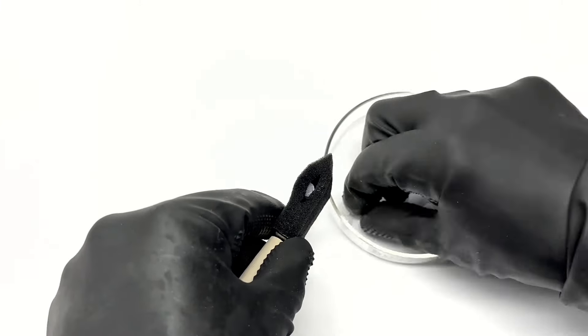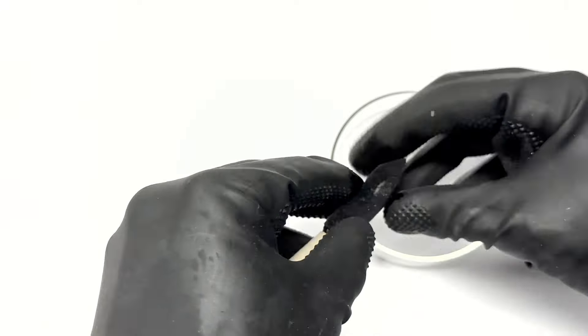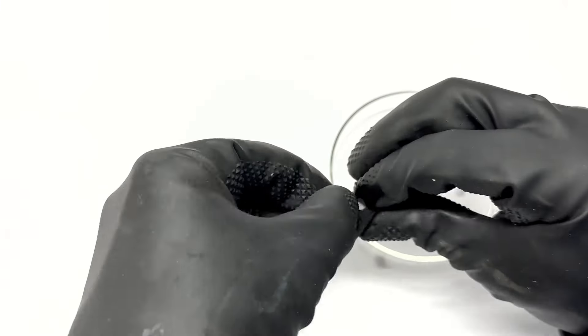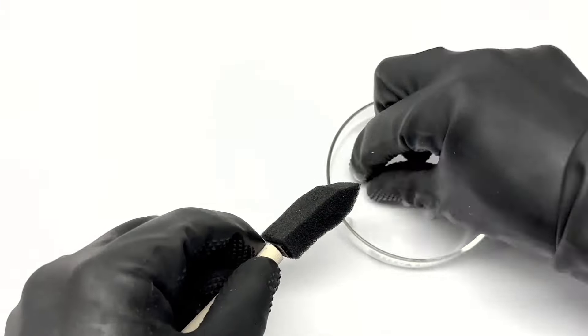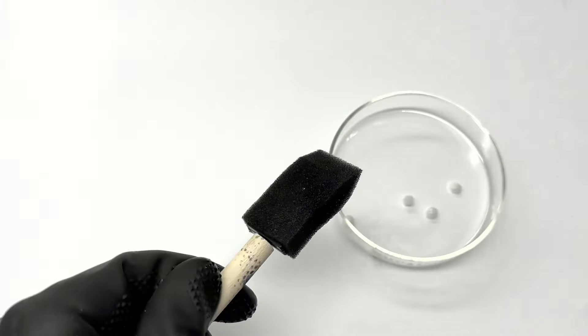You'll notice I'm wearing gloves while doing this. Sodium hydroxide is corrosive and it can burn your hands. Also, be sure to wear goggles and other appropriate personal protective equipment when doing this.